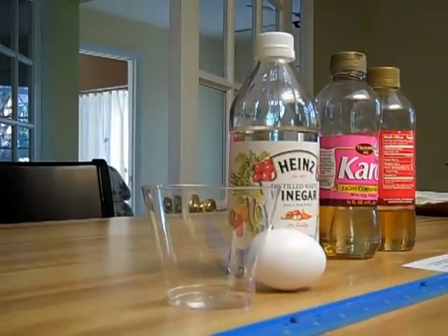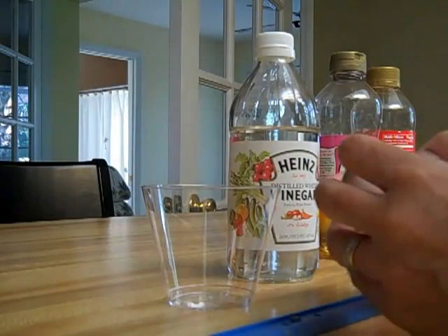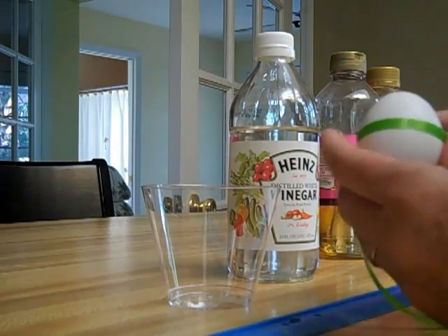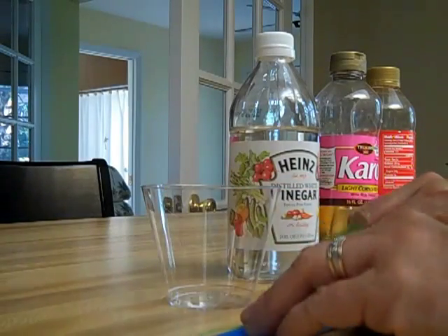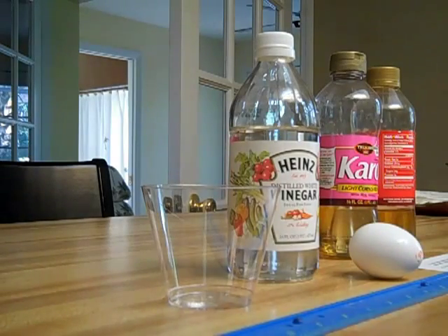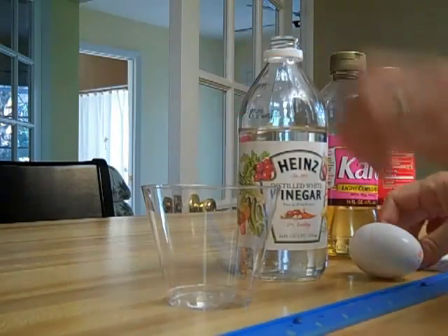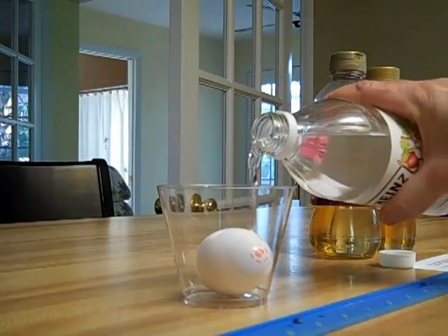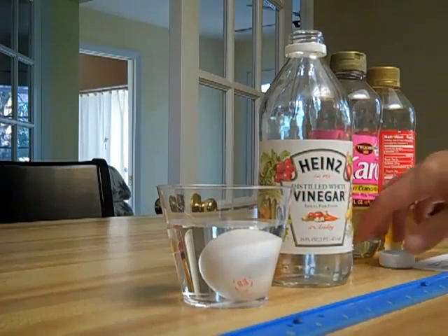I'm going to take a measurement of the egg itself. The easiest way to do this, since it is a round egg, is to just go around it with a ribbon. I'm going to pinch right there, and then lay it down on my metric ruler, lining it up, and I've got a measurement of 14 centimeters exactly. Put down your 14 centimeters, and then I'm going to go ahead and put the egg in the cup and pour vinegar over it, just to cover the egg. It might float a little bit, but as long as it's covered with vinegar, that's going to be fine.